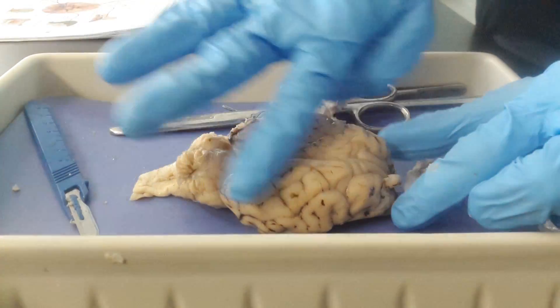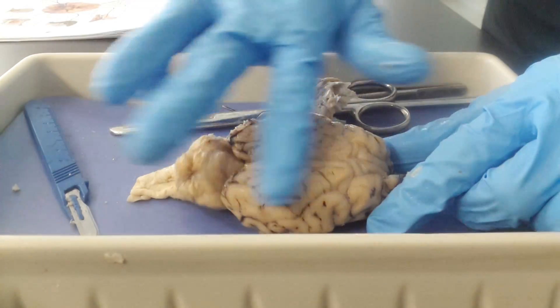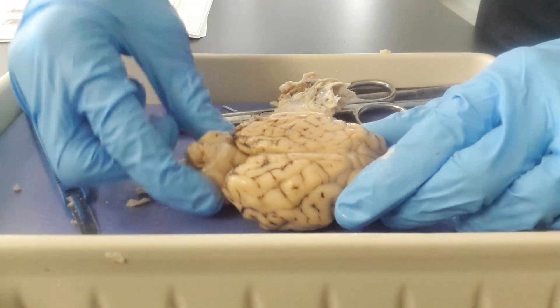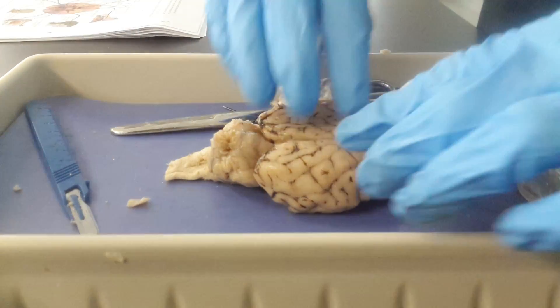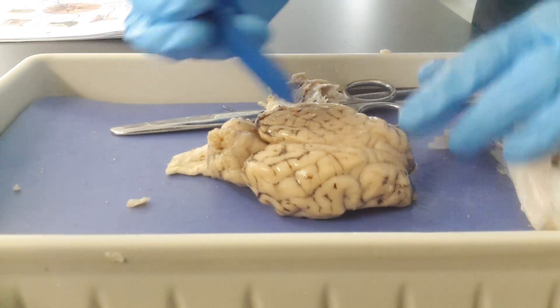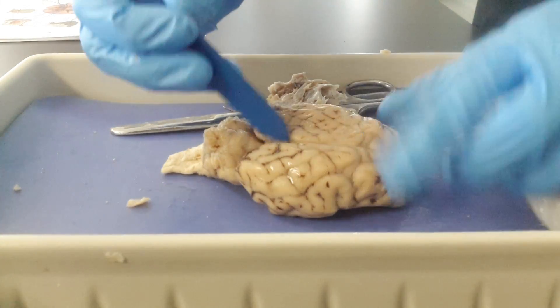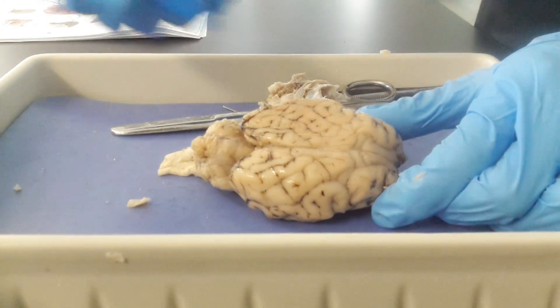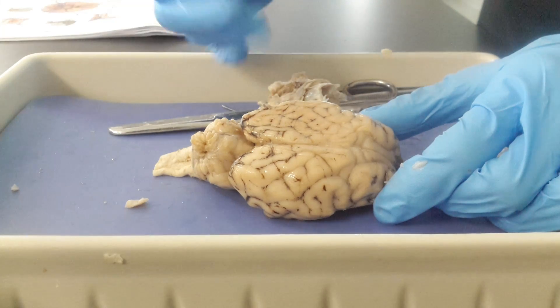Remember that this large anterior or front portion of the brain is called the cerebrum, and that this back portion of the brain here is the cerebellum. Remember that we have fissures that separate the brain into different regions. This fissure that goes right here longitudinally is the longitudinal fissure, and that separates the cerebrum into left and right hemispheres or halves.